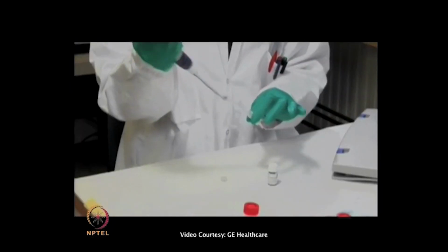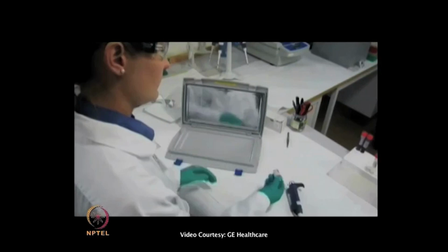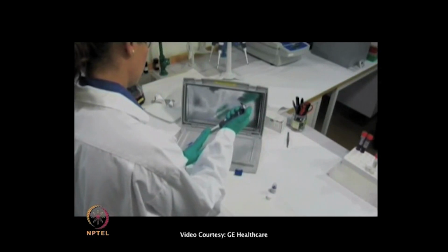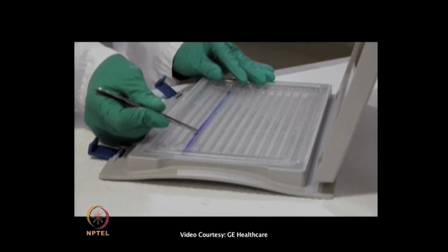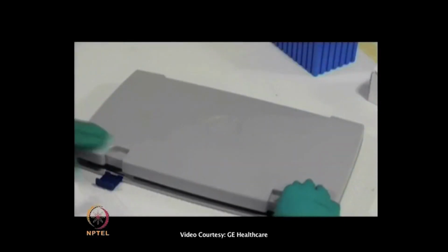The first step in 2D electrophoresis is to prepare IPG strips for rehydration. Prepare the rehydration solution by adding IPG buffer corresponding to the pH interval of the strips used, and add the solution in the lanes of the rehydration tray. Remove the protective film of the IPG strip and place the strips carefully with the dried gel facing down in the rehydration tray containing the rehydration solution. Close the lid of the IPG box and rehydrate the strips overnight.